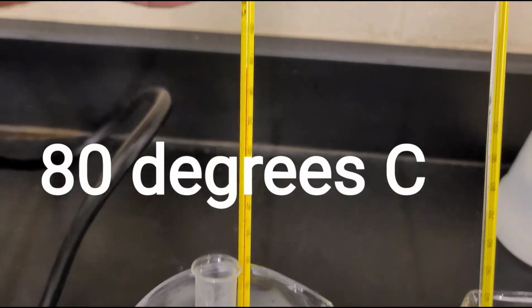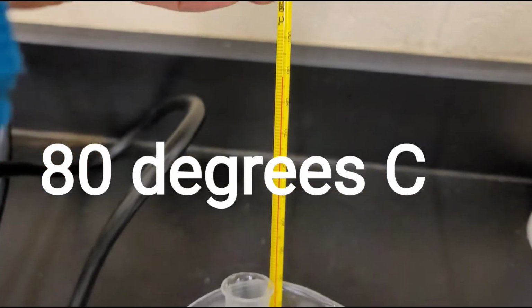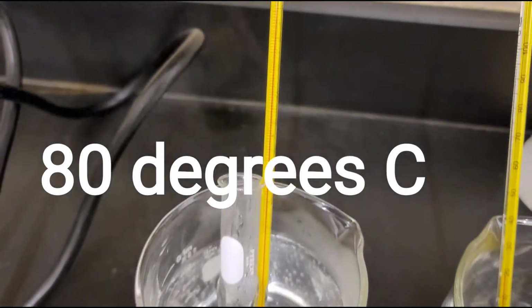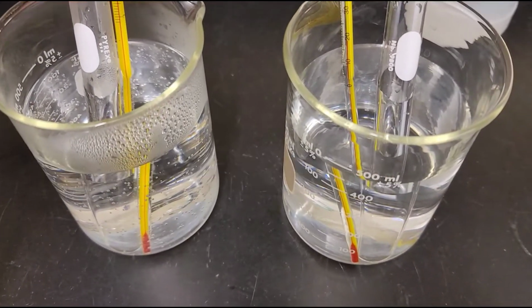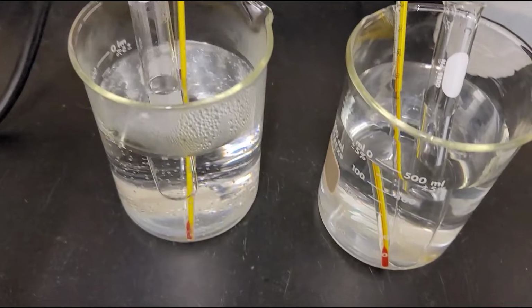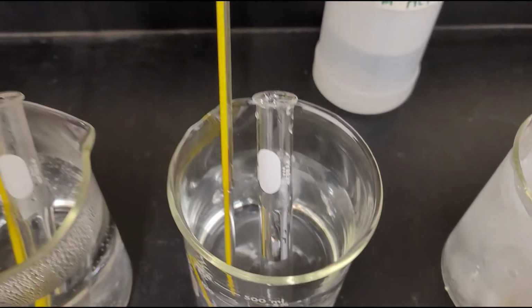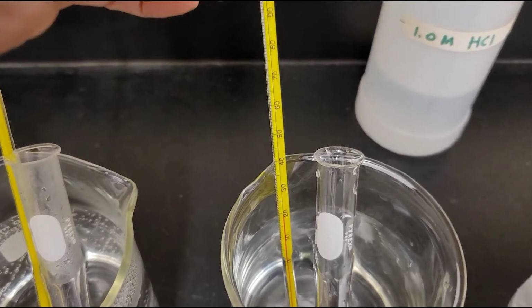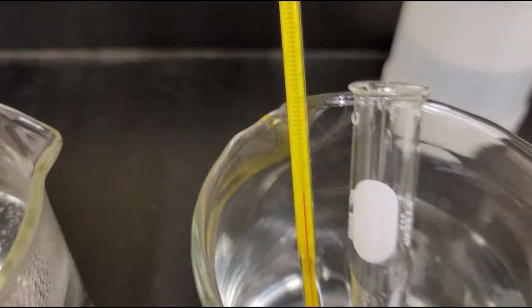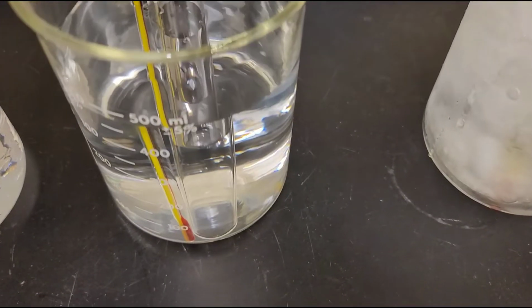So this was my hot water bath. Its temperature is, as you can see on the thermometer, you can see the steam coming off it. I have my 10 mils of 1 molar HCl in the test tube, which is in my hot water bath. And then I have room temperature water. You can see the temperature of the room temperature water. And same thing, I have my 10 mils of HCl in my room temperature water.